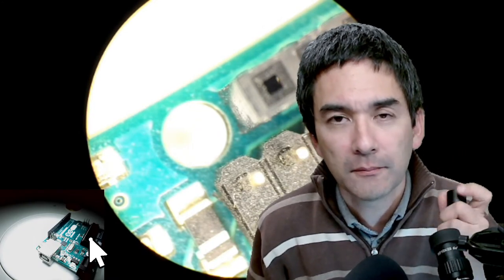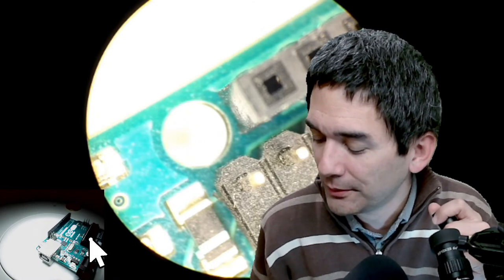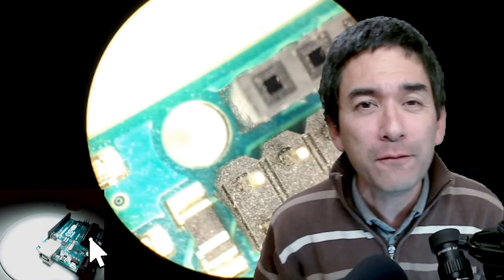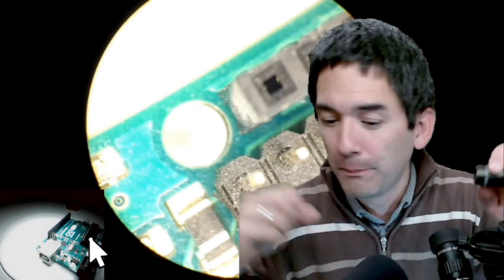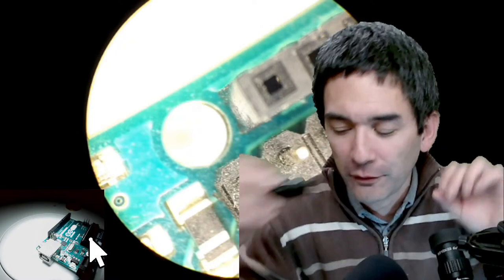The method of using a mobile phone or compact camera in front of an eyepiece has a specific name: afocal photography. If you search for afocal photography, it describes placing a small camera or mobile phone in front of the eyepiece.